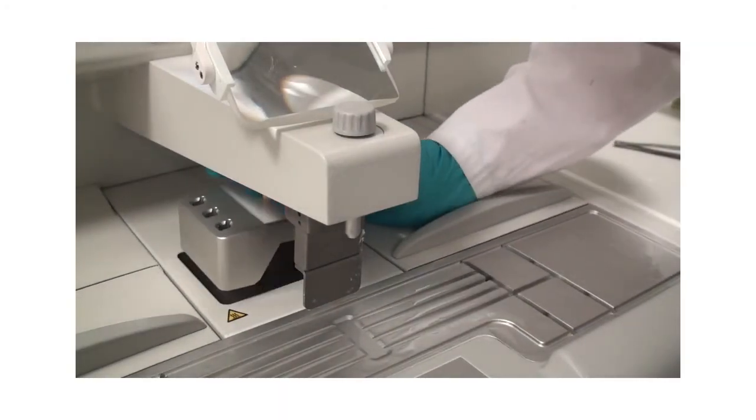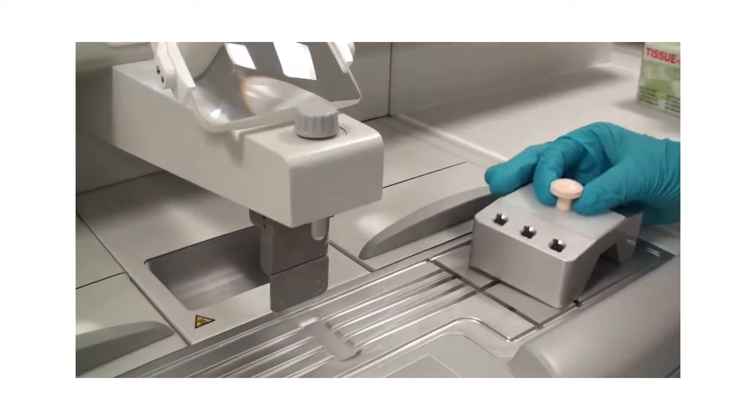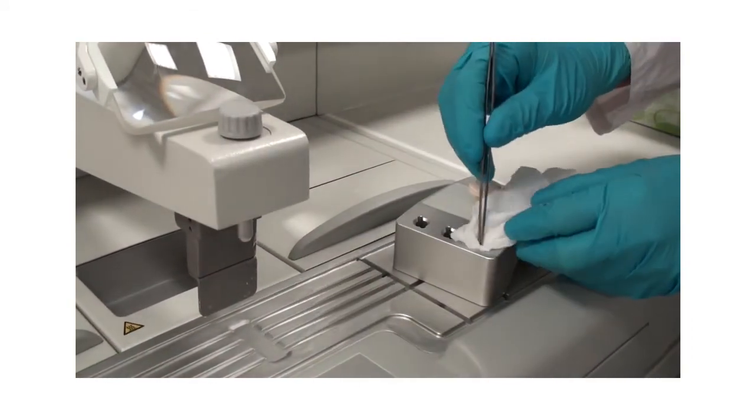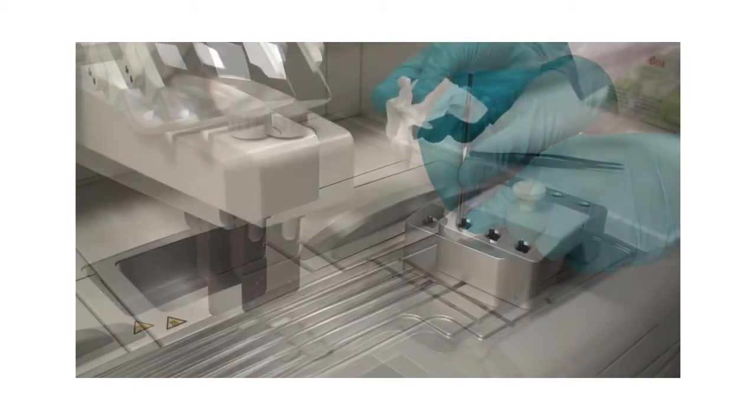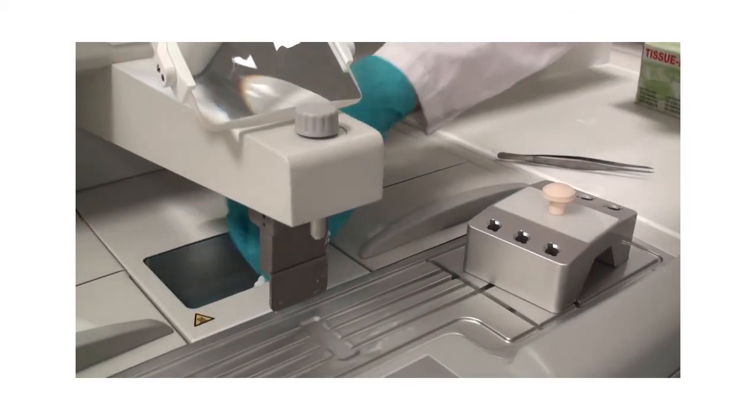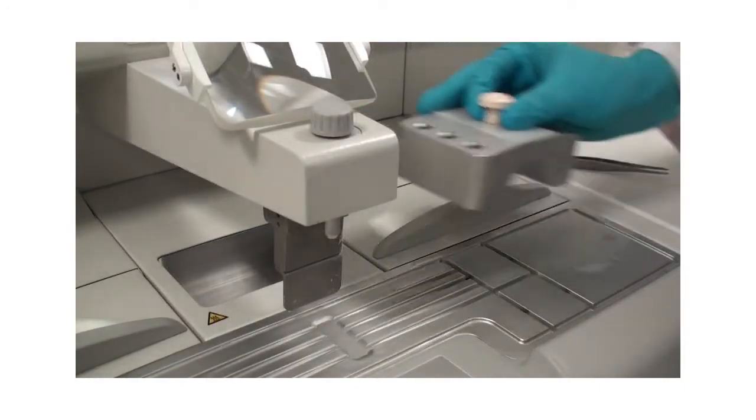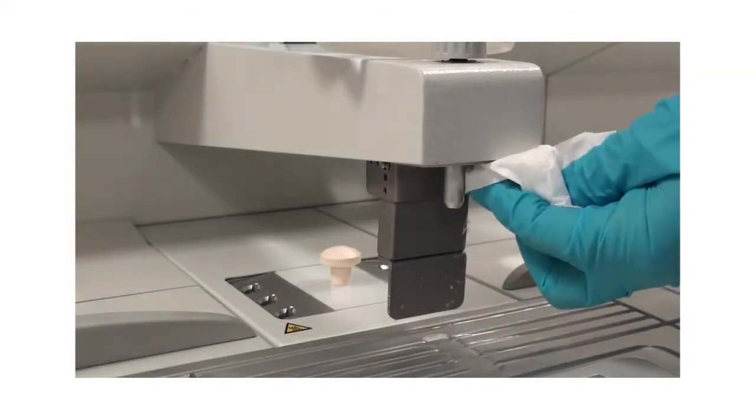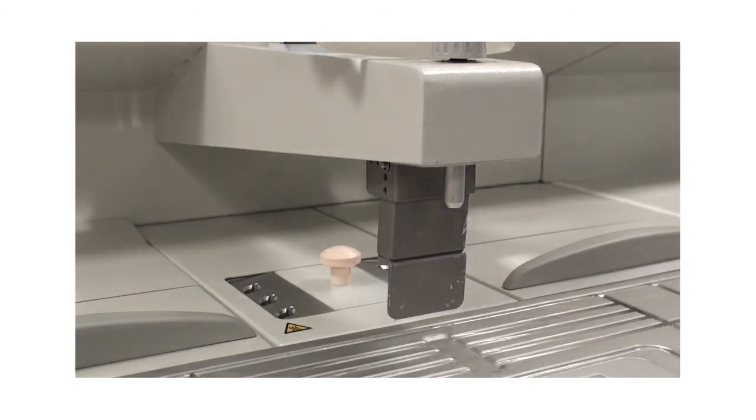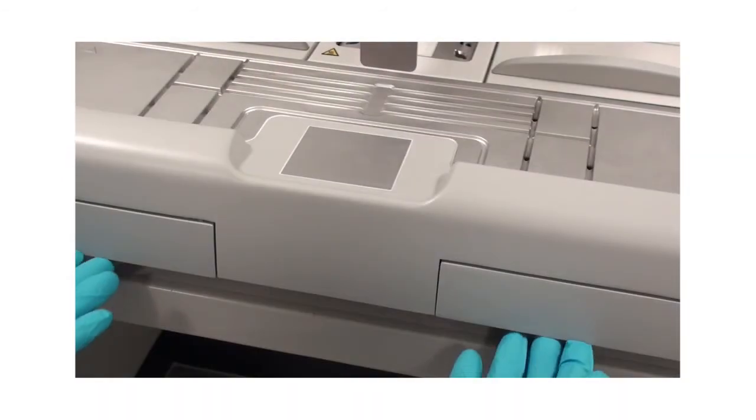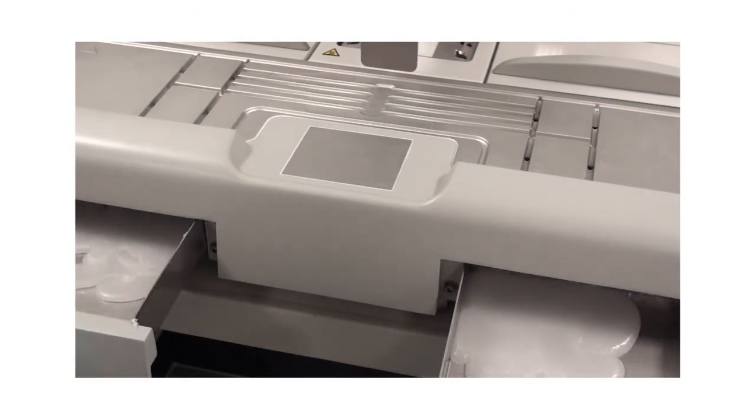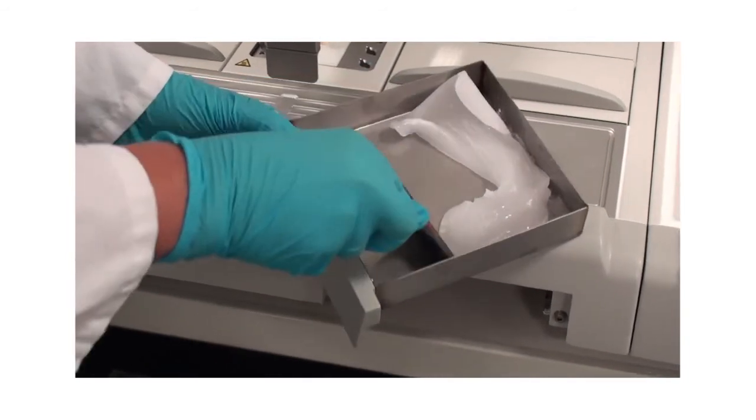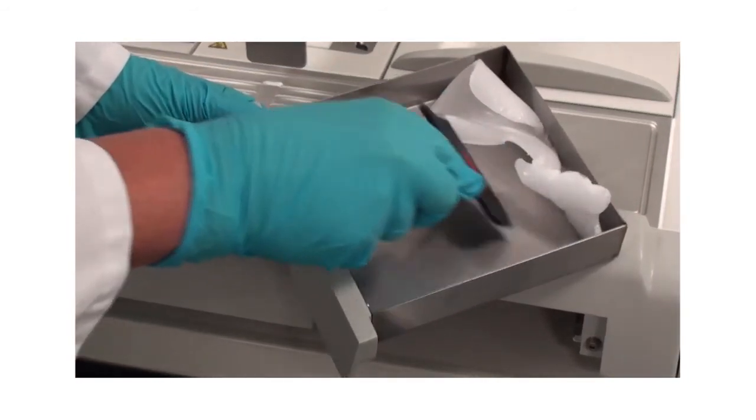Once per day, clean the forceps holder thoroughly with paper tissue. Regularly clean the light surface. Empty both paraffin collecting trays at least daily in order to prevent overflowing into the instrument. For removal, the paraffin collection trays must be warm. Do not reuse the paraffin.